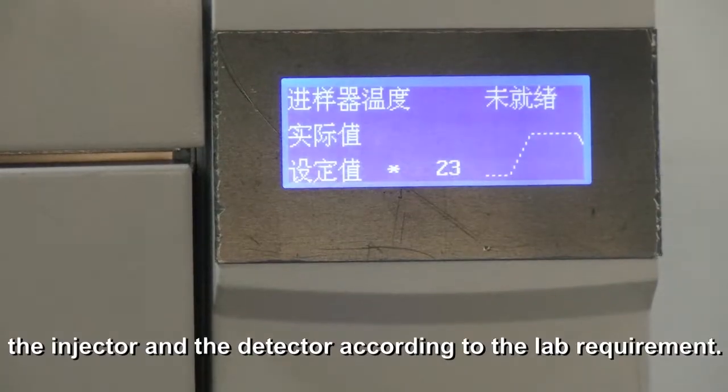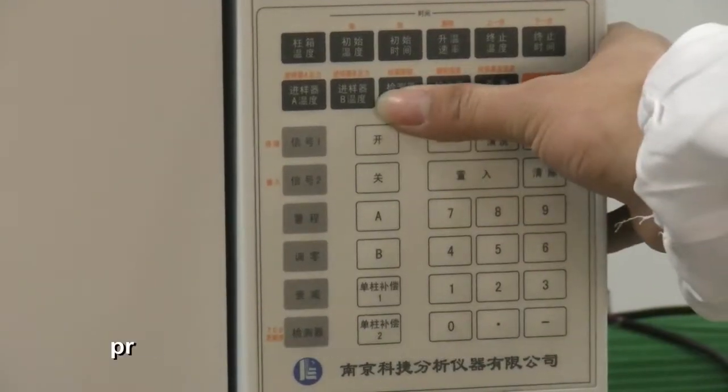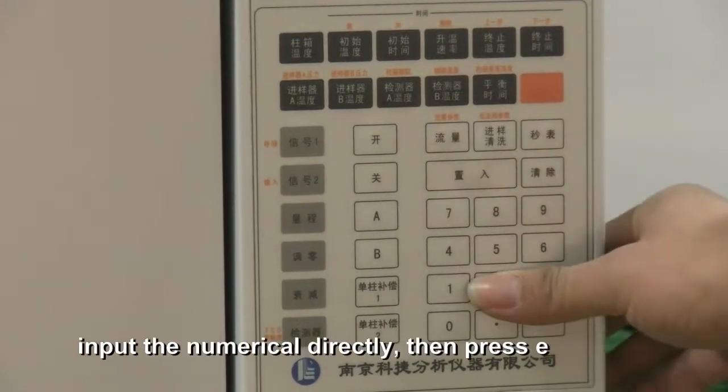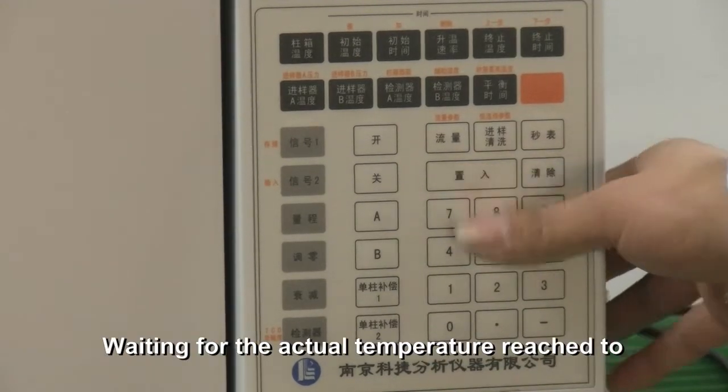The specific operation is: press the corresponding key on the panel, input the numerical value directly, then press the Enter key, and you will finish the operation. Wait for the actual temperature to reach the set temperature.